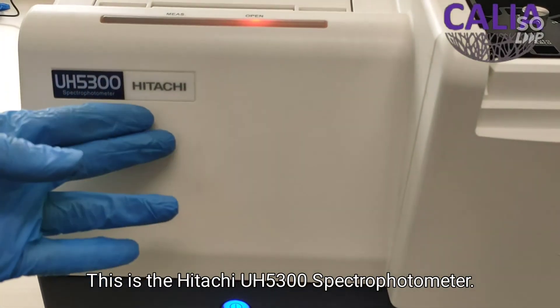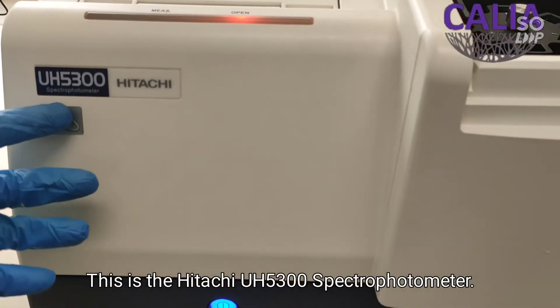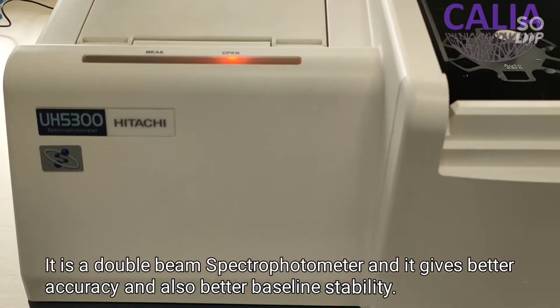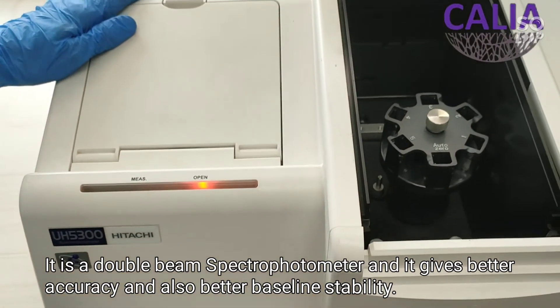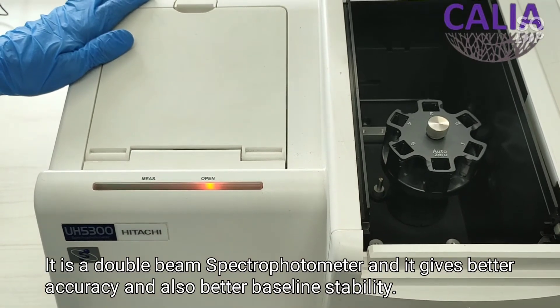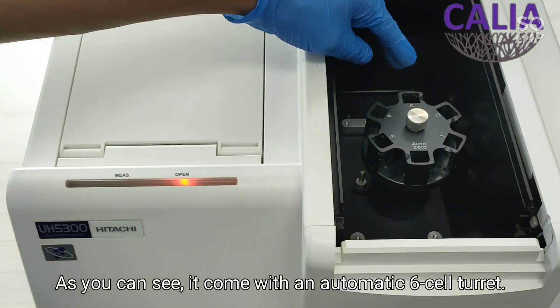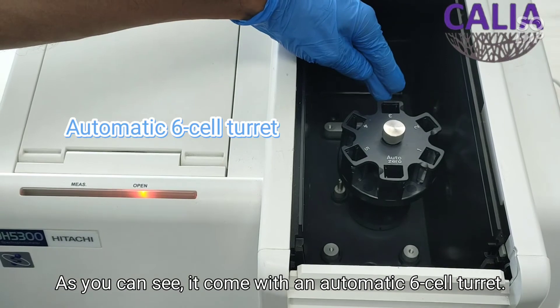This is the Hitachi UH 5300 spectrophotometer. It is a double beam spectrophotometer and it gives better accuracy and also better baseline stability. As you can see it comes with an automatic six cell turret.